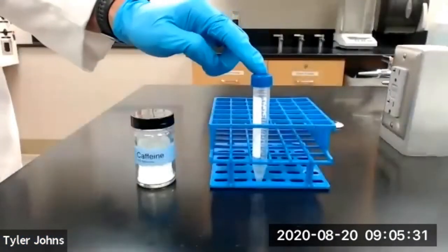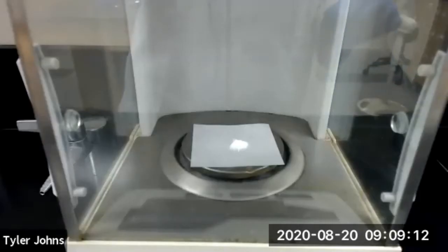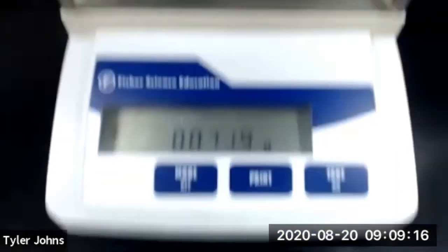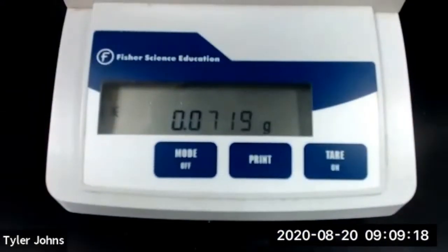The mass of caffeine that we will be using is 0.0719 grams.